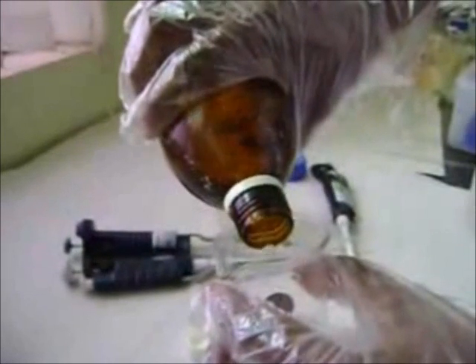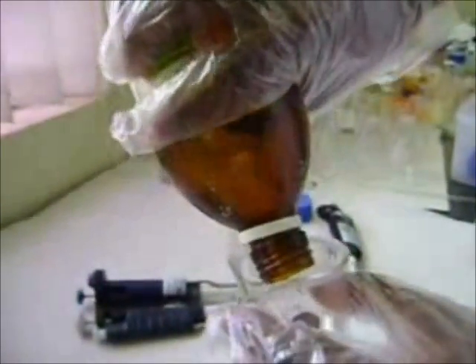The next step is urea-PAGE. A 6% acrylamide gel is prepared with 7 molar urea, acrylamide and bisacrylamide, 1x TBE buffer, 10% APS, and TEMED. The gel is filtered and injected between the IPC base and glass plate. After polymerization, the comb is removed and samples are loaded along with the dye, and the unit is run at 100 volts.